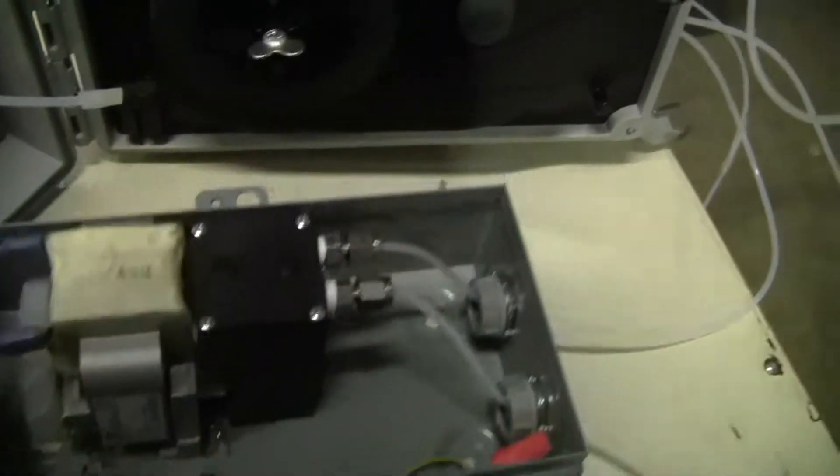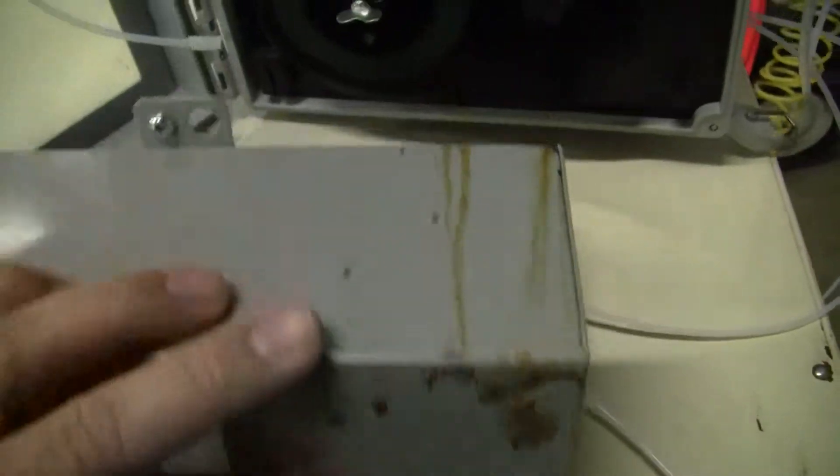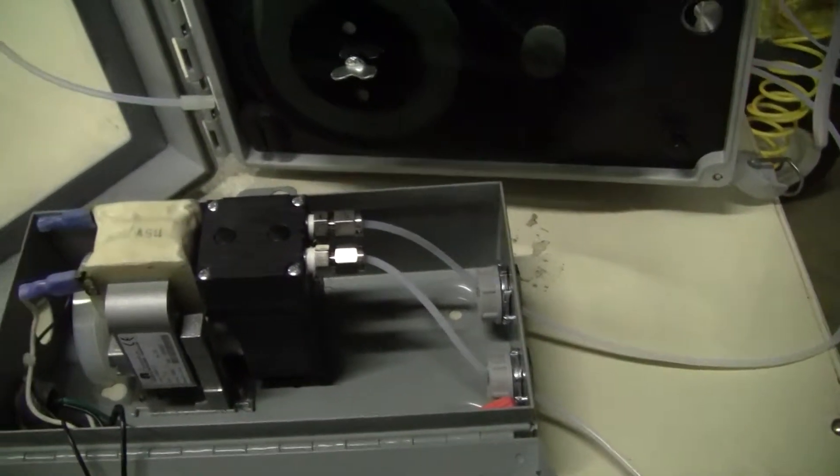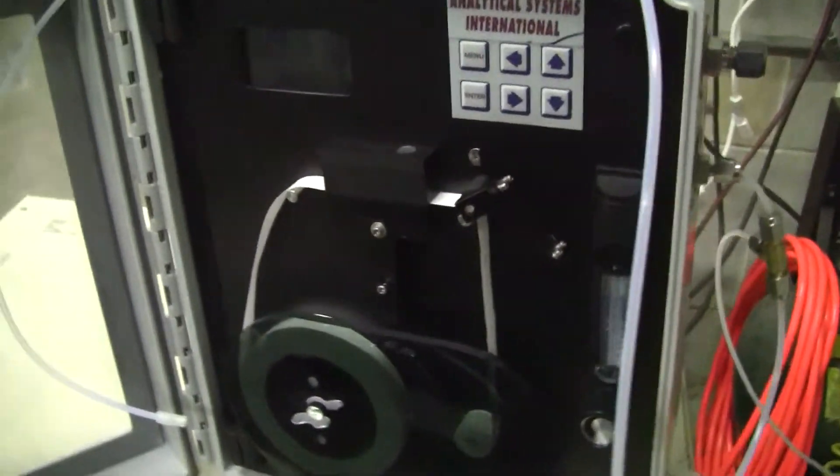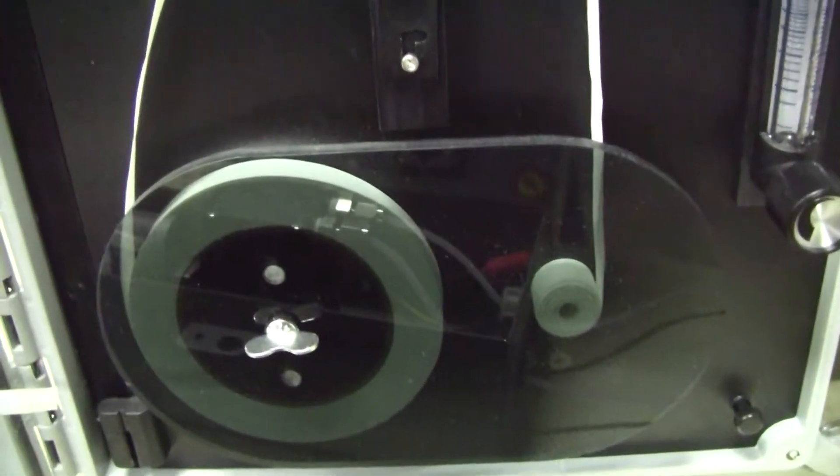A little cute pumping unit. It has its own on-off controller. Flow. Turn that off because it's kind of loud. Flow rate. Tape unit.